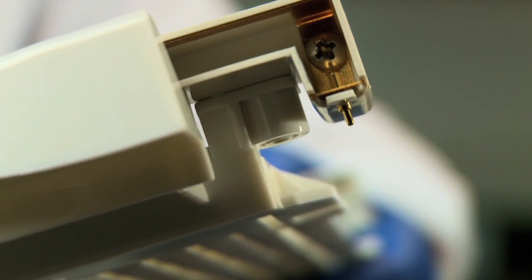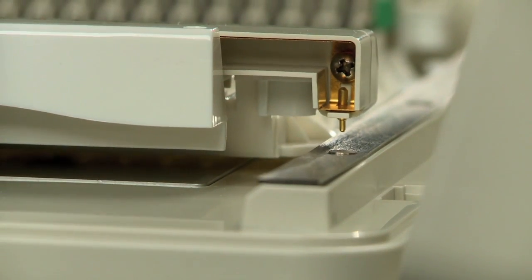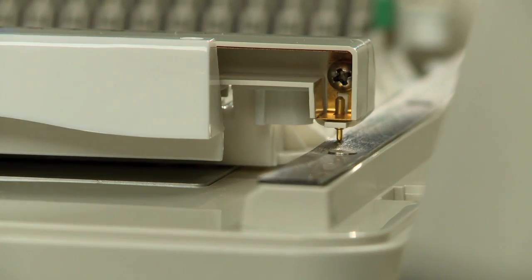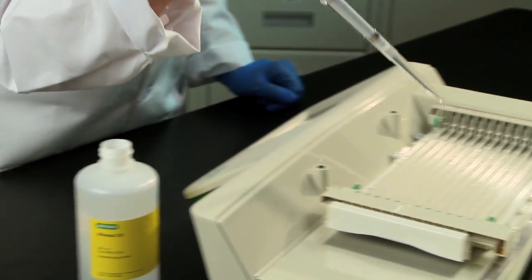Check to make sure that the pin on the negative electrode assembly has made contact with the metal strip on the instrument. Overlay the strips with mineral oil.